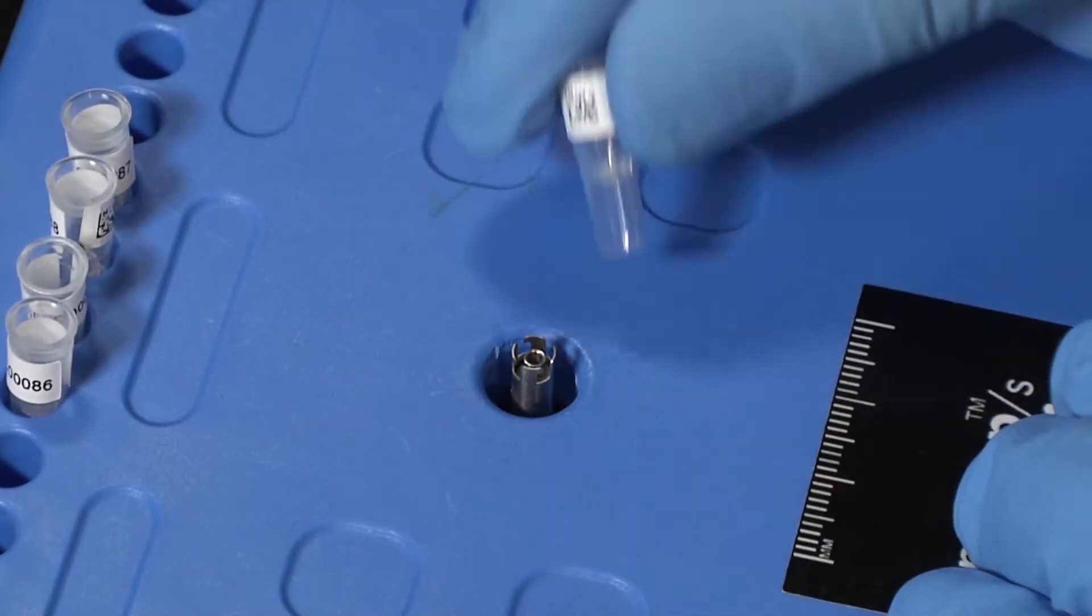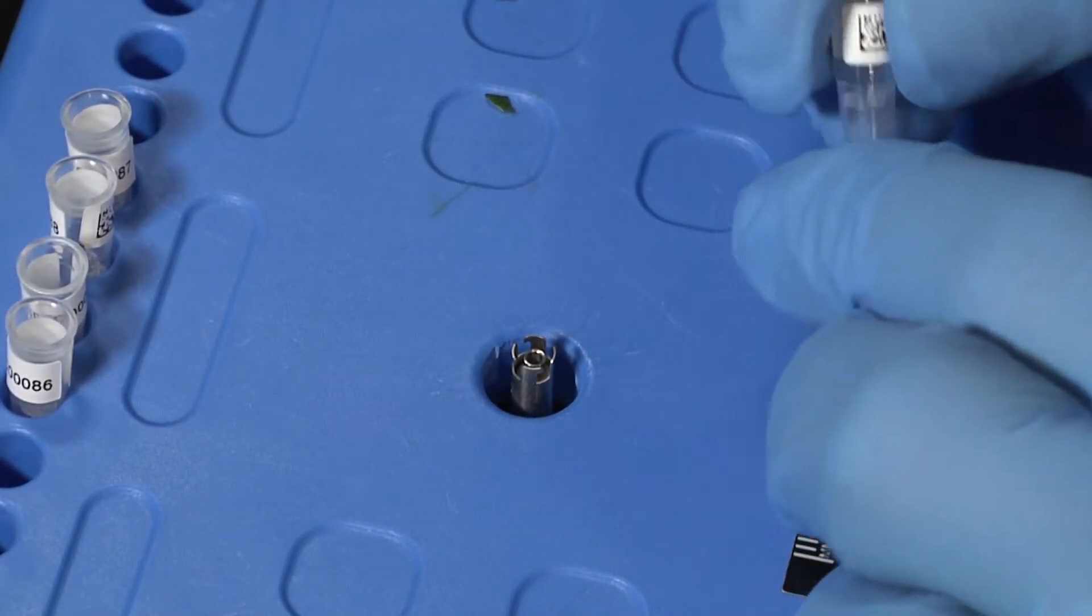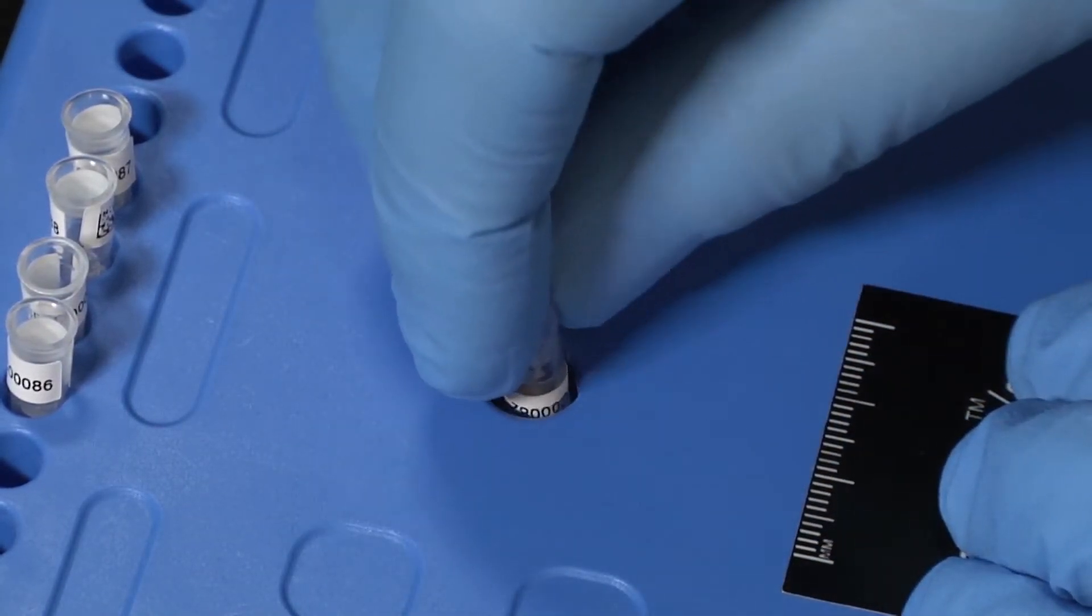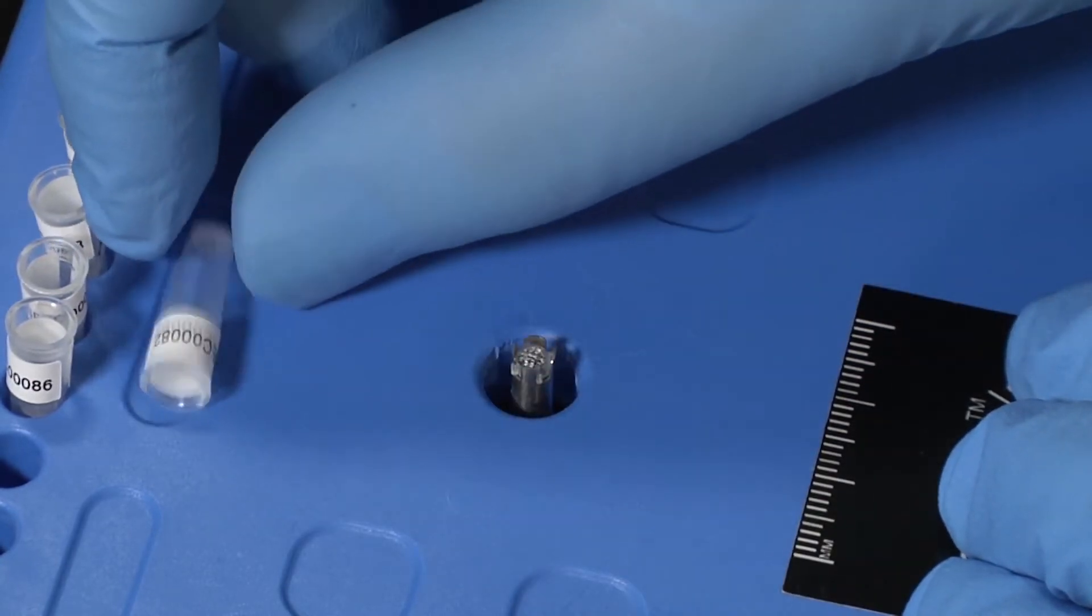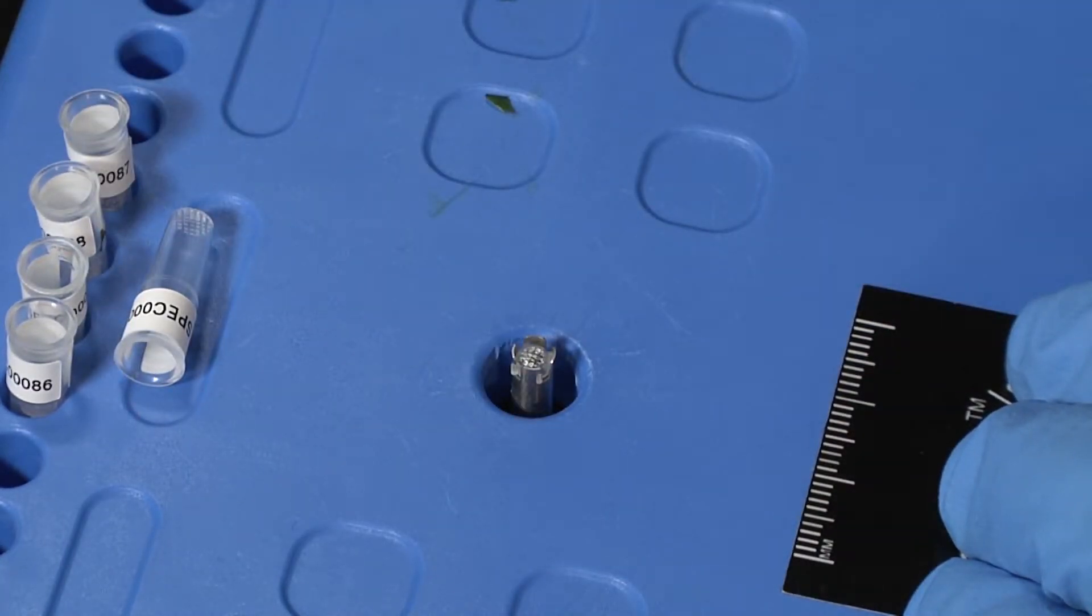Screens are easily loaded into the insertion tool. First, we will show this by loading the screen from an MPREP-S capsule. To load a screen from an MPREP capsule, simply slide the capsule over the insertion tool and align the screen tabs into the insertion tool's slots. Rotate about one-eighth turn clockwise to engage the tabs and then lift off the capsule.